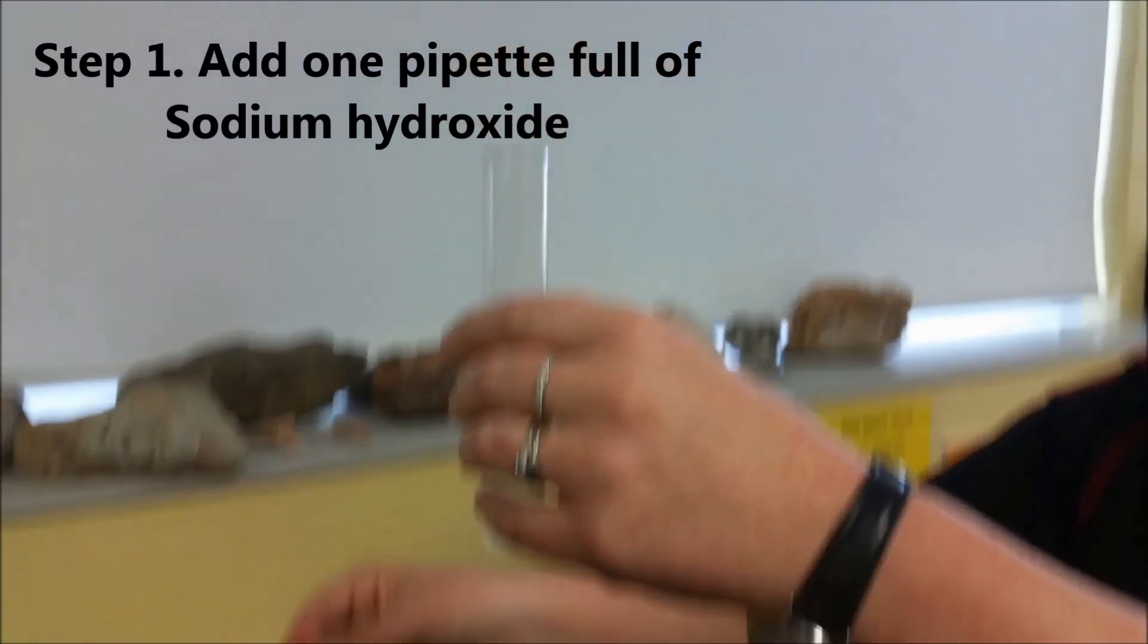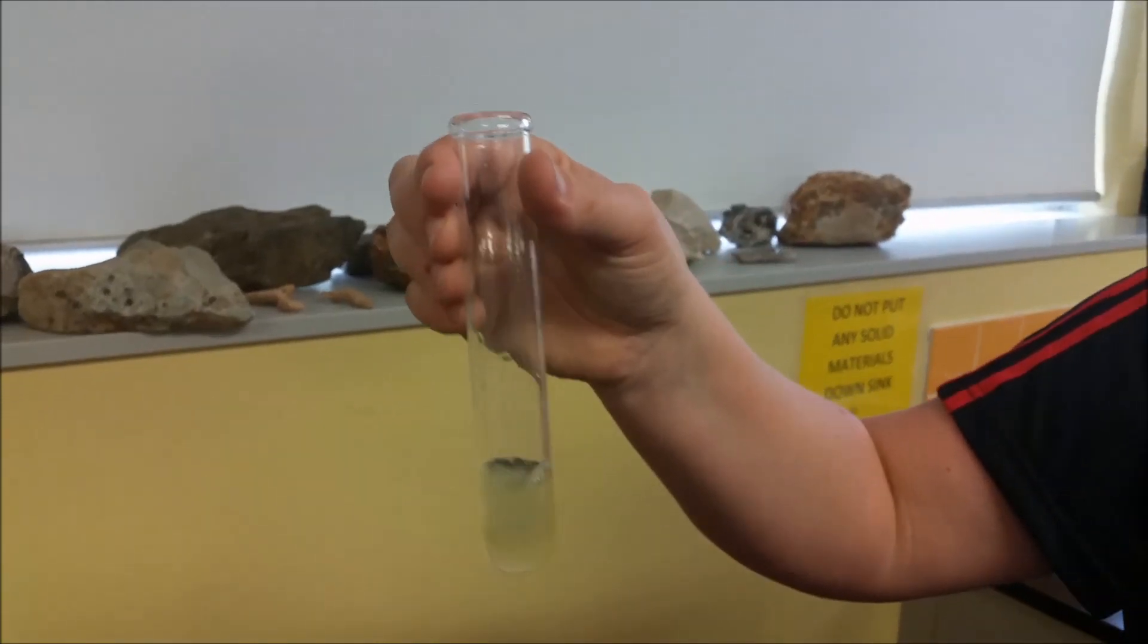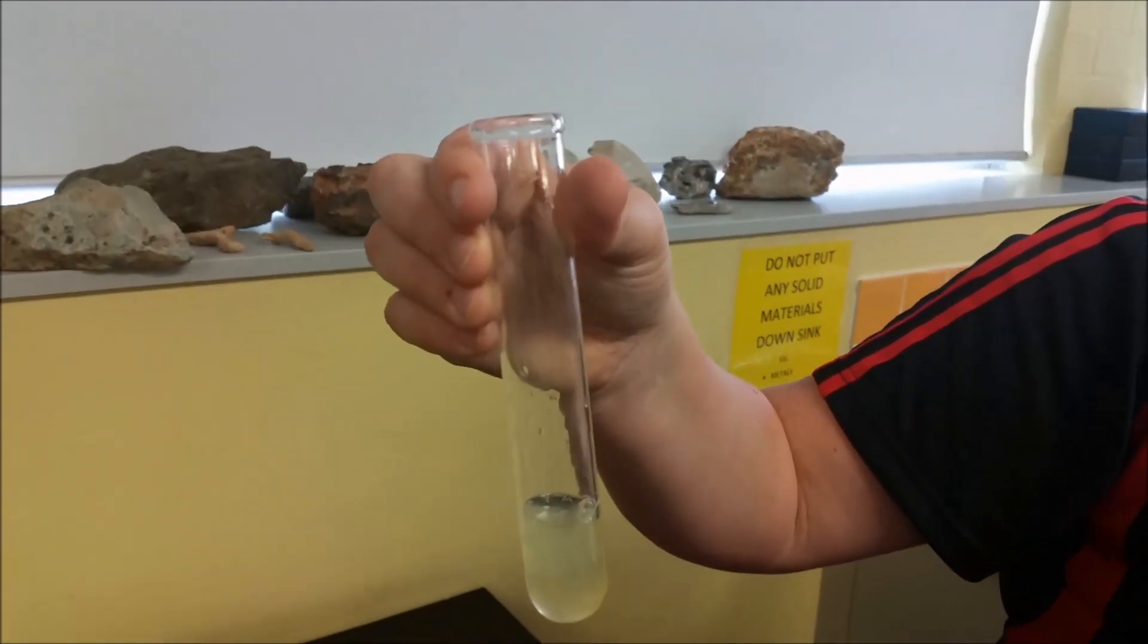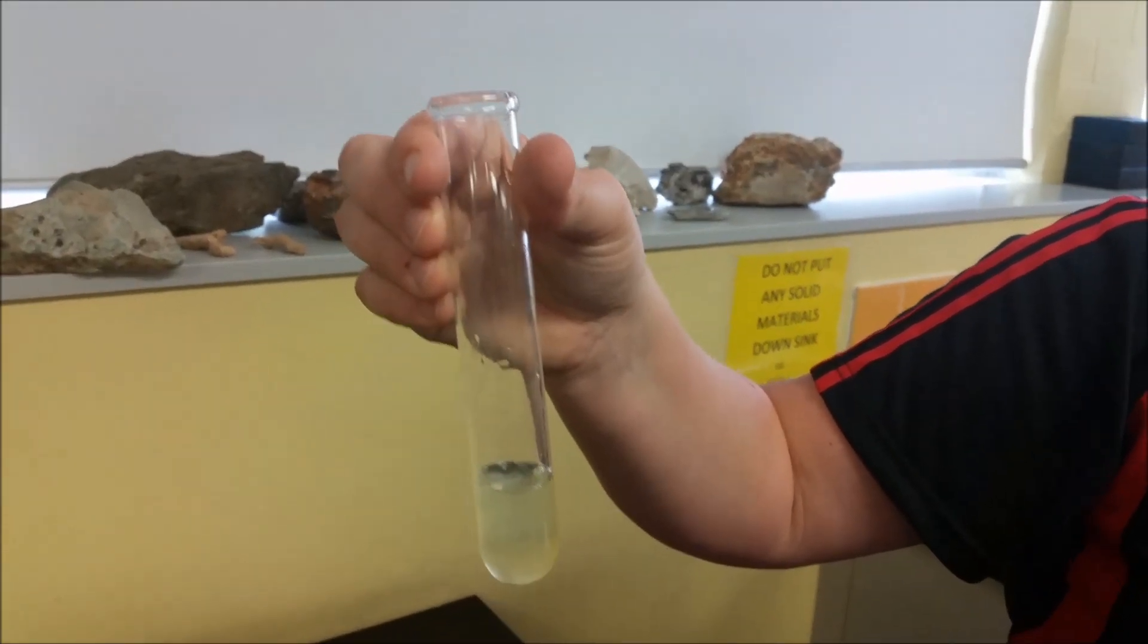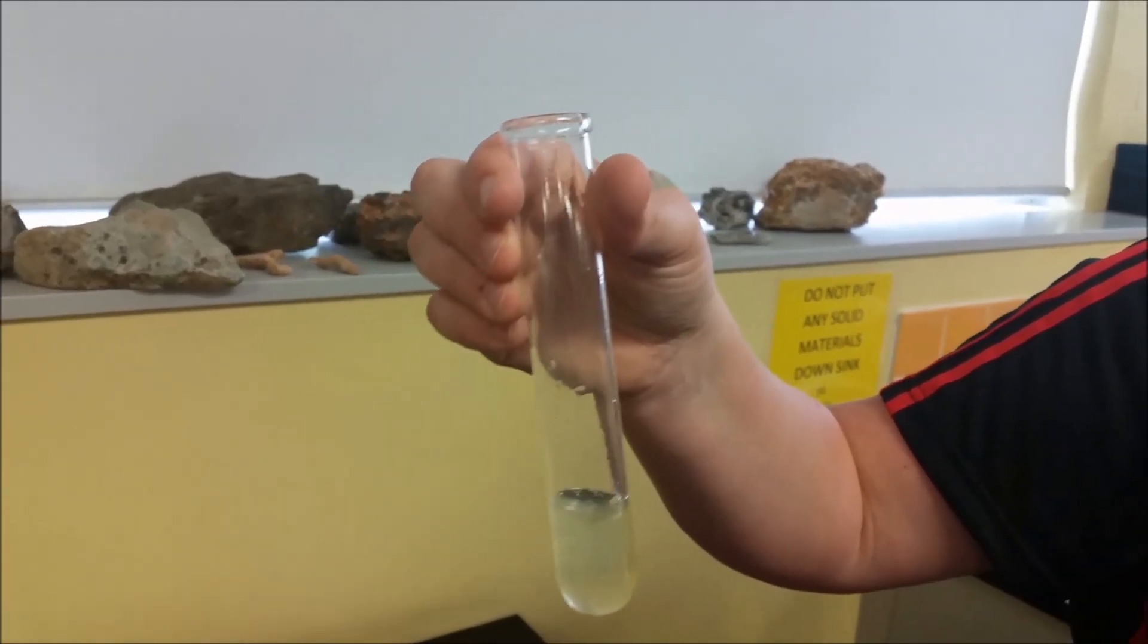Sodium hydroxide is a hazardous chemical, so make sure you are careful with that. As I did there, you place it inside and then squeeze. You don't want it getting onto your fingers. And with any time you are using chemicals, what would be the other safety gear you guys should wear? Goggles. Yeah, goggles. Good.